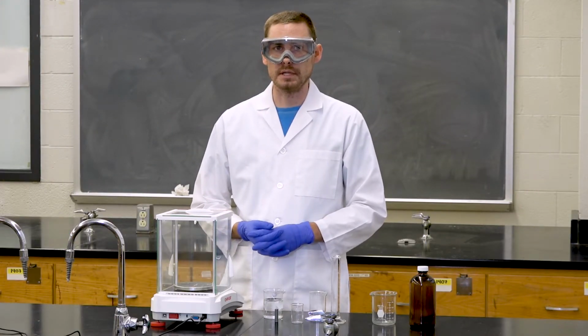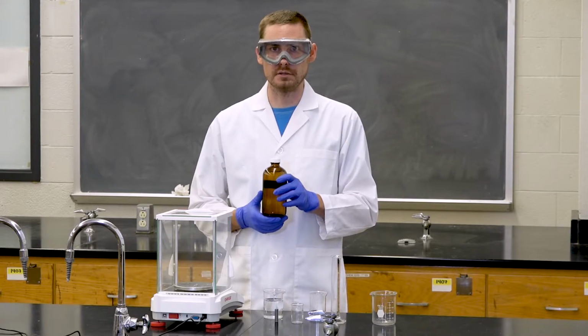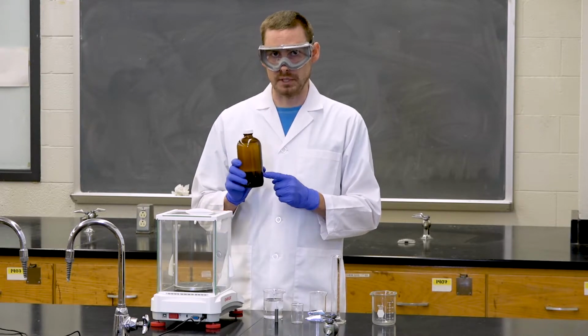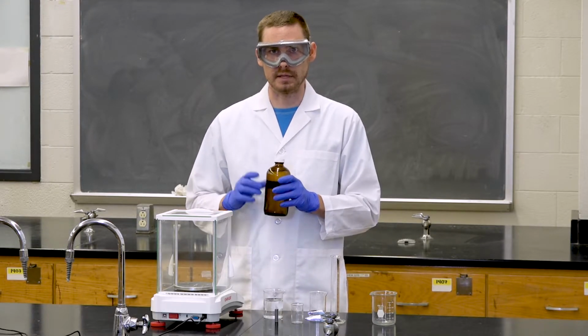Next, we will be determining the density of an unknown liquid. In your lab book, there is a table with glycerol percentages and their respective densities. We have a sample here, which is glycerol with water of a certain percentage. We're going to be determining the percentage of glycerol in water by measuring its density. To do so, we're going to add 20 milliliters of this glycerol unknown to a graduated cylinder and measure it in the analytical balance and then calculate the density.